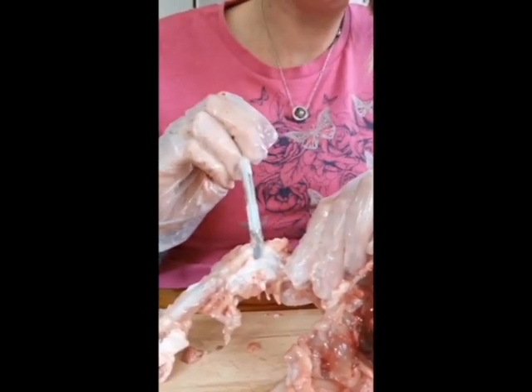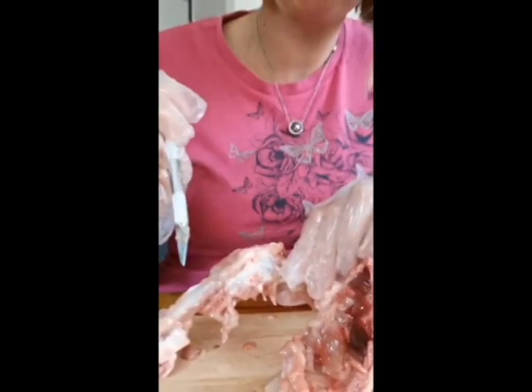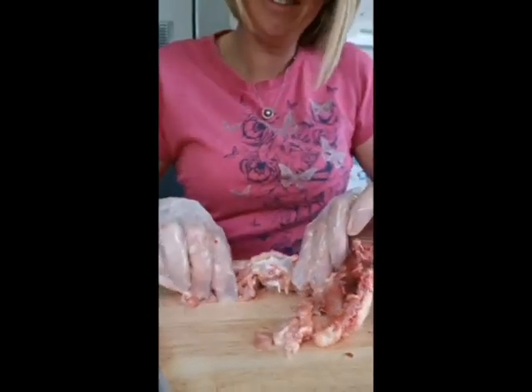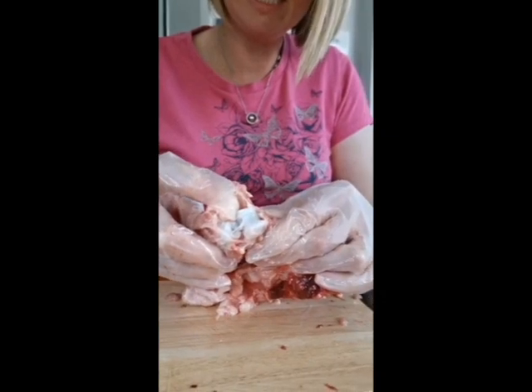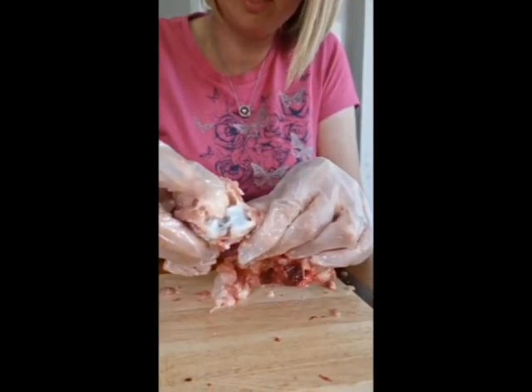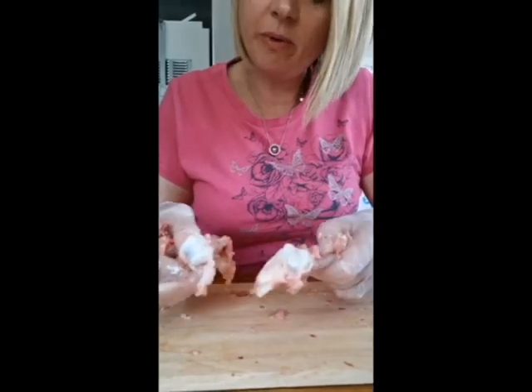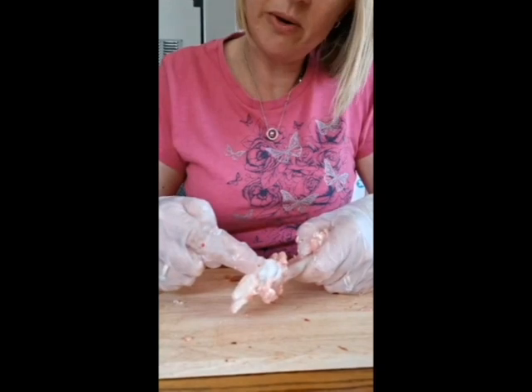Now I'm going to have a look, see if I can expose some of the cartilage for you. So I'm just going to remove the bones away from each other. Okay, as I'm taking them apart, you can see the ligaments really clearly now. So if you couldn't see that one that I was focusing on before, there's quite a few in there for you to have a look at, okay? Remove the bones away from each other here. So now I've exposed this end of the bone here.